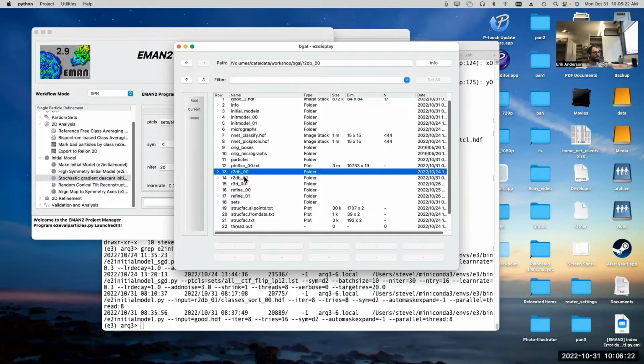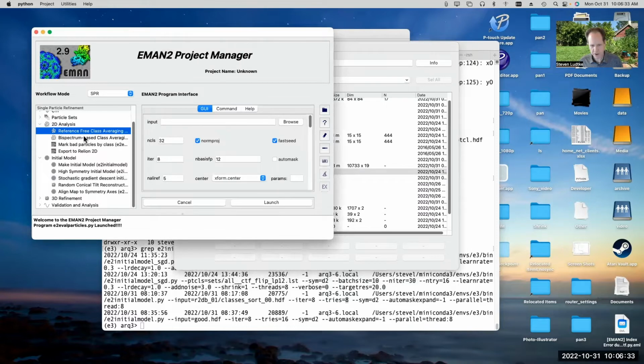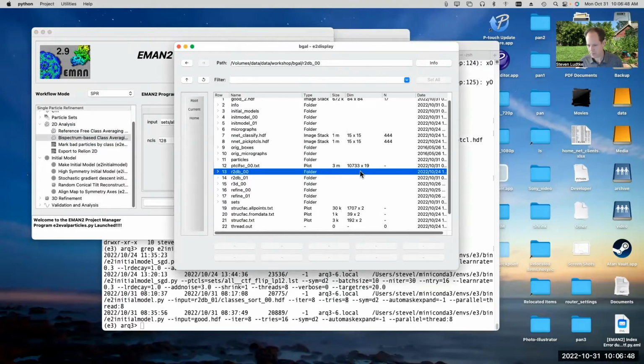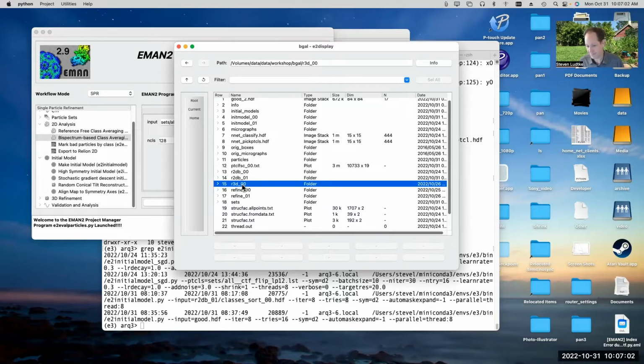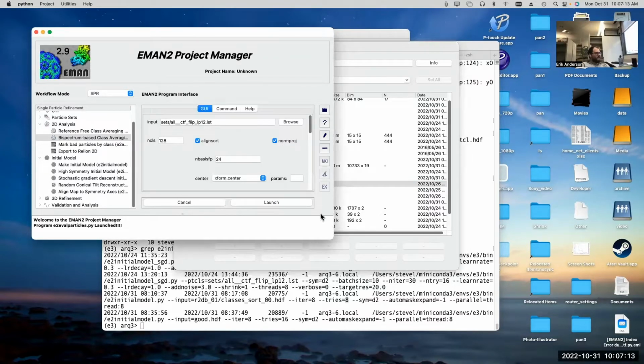R2DB, that stands for refine 2D, and the B stands for bispectrum. In the 2D analysis, there's a reference-free class averaging, which is the old style class averager, which works really nicely, and sometimes you might still need to use it, but it takes a lot longer to run because it's iterative. And then the new bispectrum based ones, the B stands for bispectrum. Gotcha. Then refine, that should be pretty straightforward. That's 3D refinement, and R3D, refine 3D, it's the new program. No good reason. Cool. Yeah. All right. Thanks.